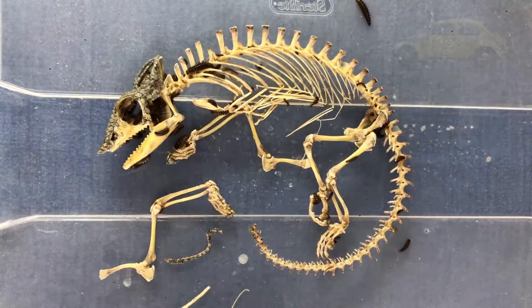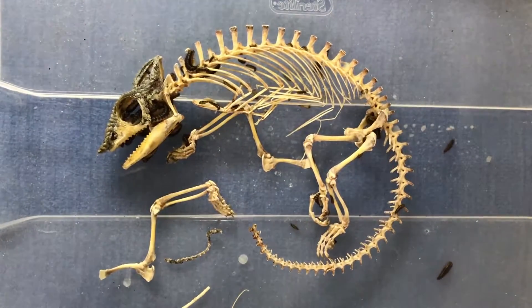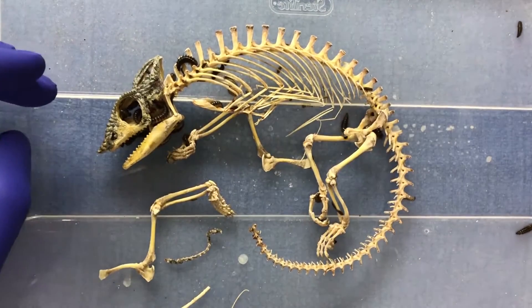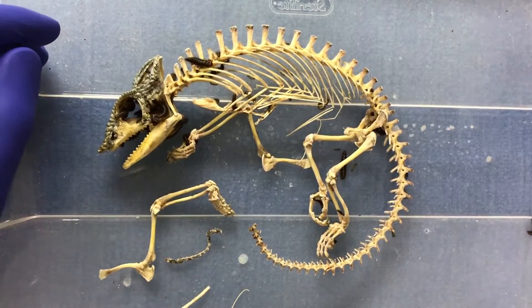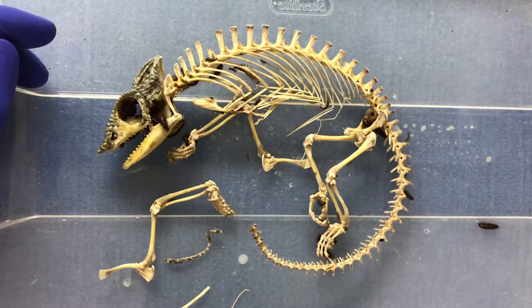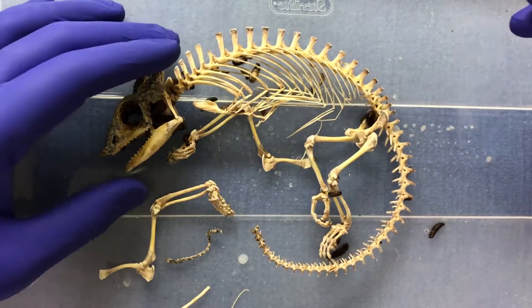I call this process teasing the beetles because I want to try to get as many of the dermestids out of the skeleton as I can, so I don't kill them when I clean the skeleton — drown them, or if I put them in a hot solution, I don't want them to suffer like that. That's pretty raw.